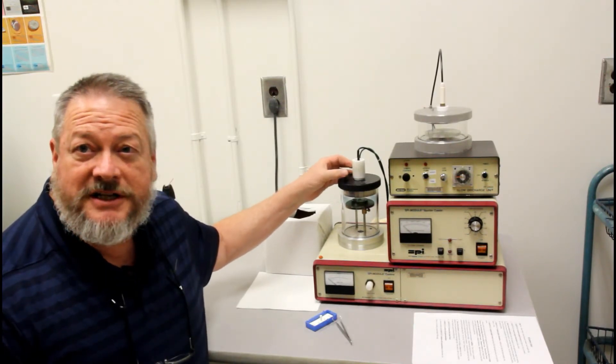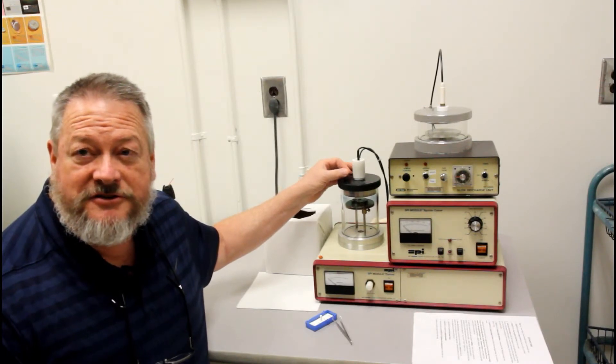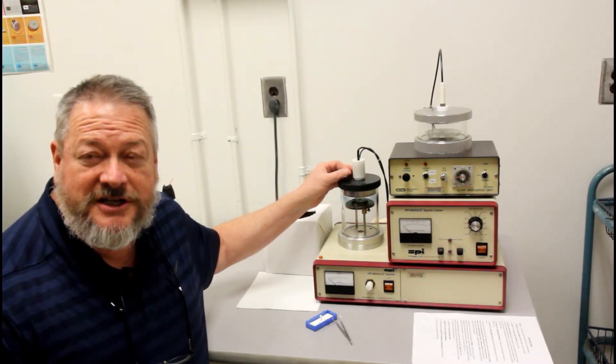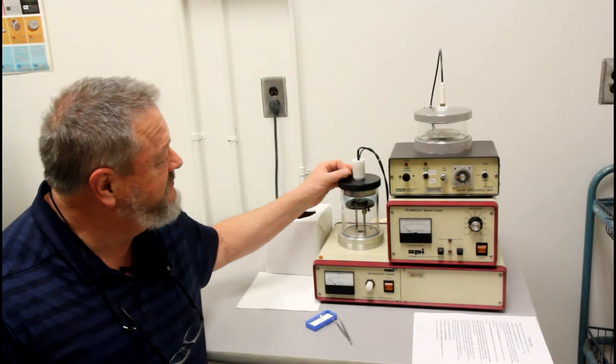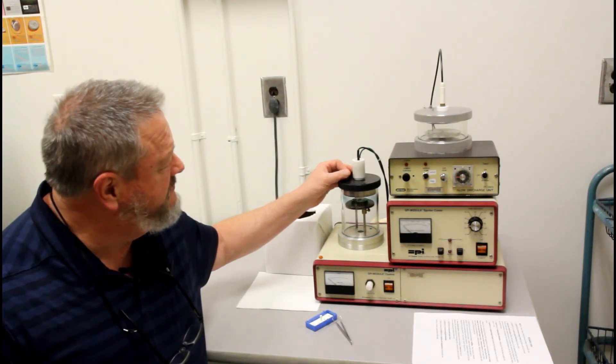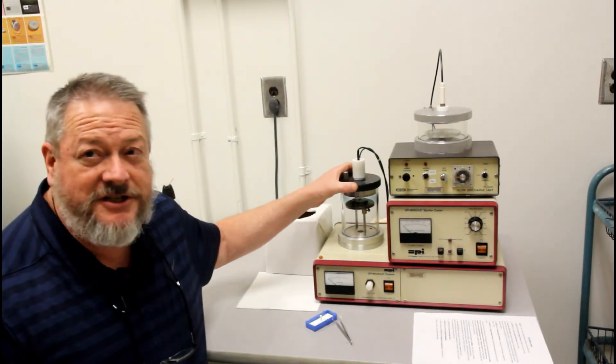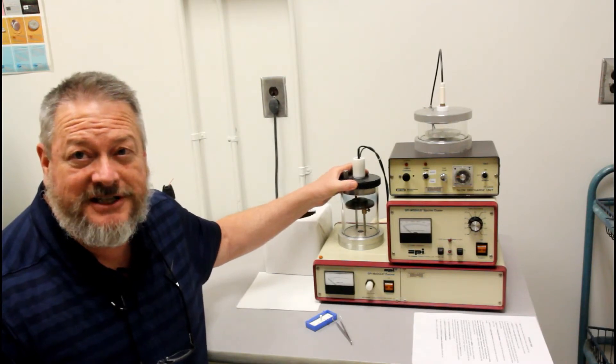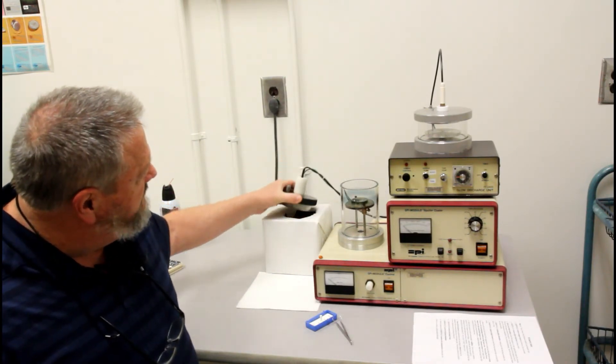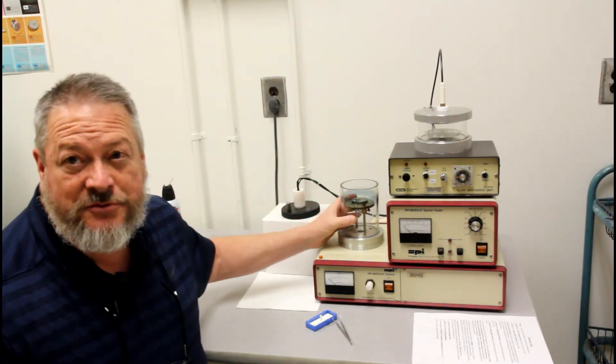Typically I loosen a little bit and then maybe push back on it. There's an O-ring inside there. You should hear a slight hissing. When it's finished, you should be able to easily lift the lid and then remove your sample.